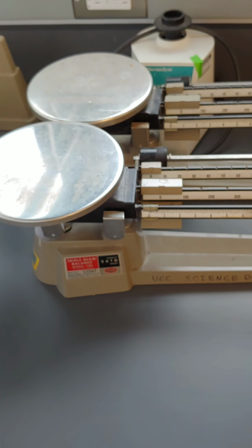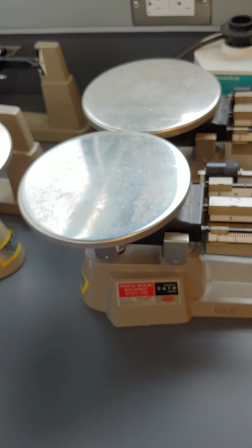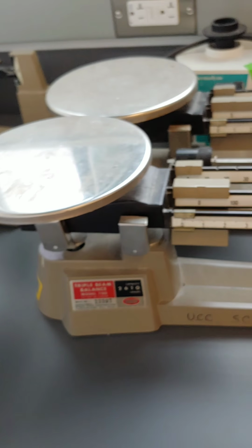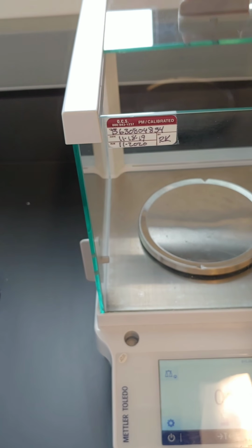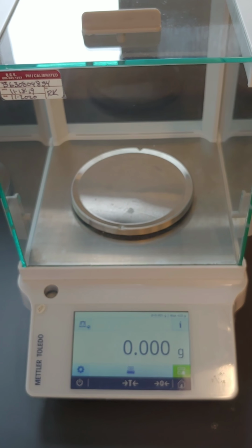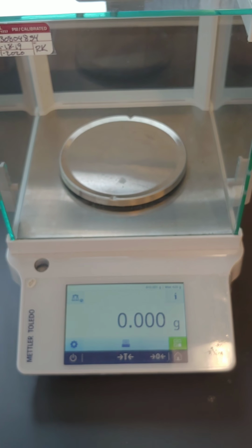Okay, the last thing I wanted to talk to you about was these things here. These are what are known as triple beam balances. One of the questions at the end of the lab asks you about the digital balance and then the triple beam balance. What we know about balances, again, is that we're measuring mass rather than weight. The mass of an object never changes. The weight of an object is dependent on the force of gravity.